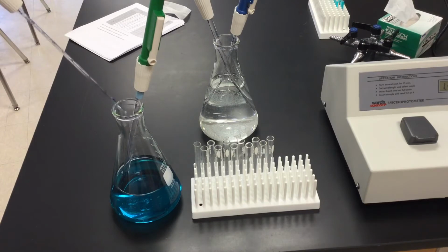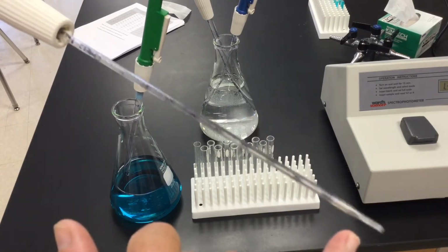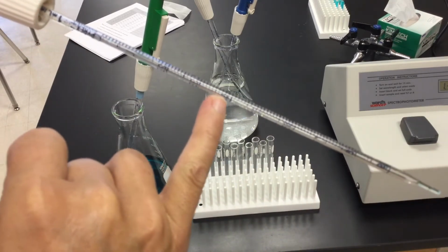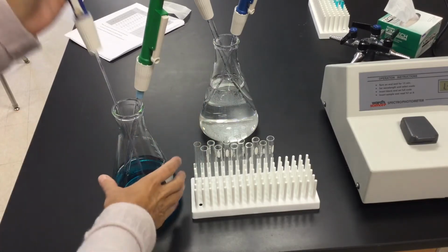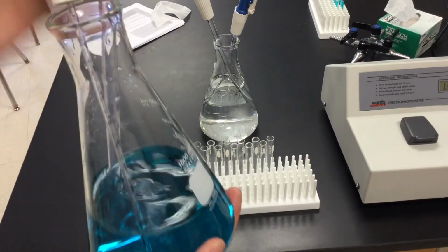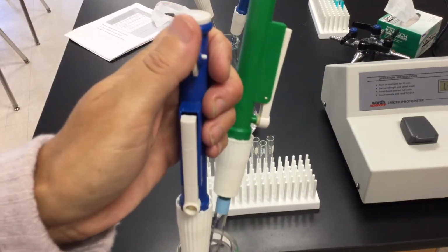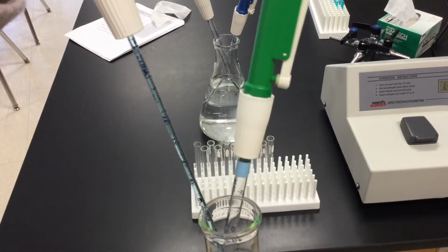I also have a 1 ml tube in there as well, and it does the same thing. So I can measure up to 1 ml, and this is what I'm going to be using to measure those tiny half milliliters that I need. So once again, as you're going through and I want to actually measure something, I'm just going to go through and I'm going to wheel this up. And as I wheel that up, what you're going to see is that this is going to fill up.